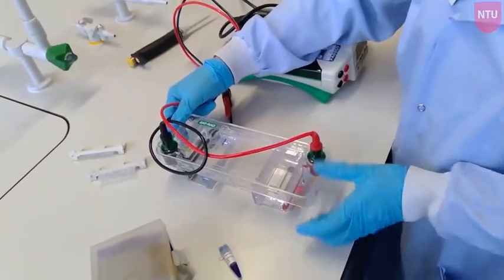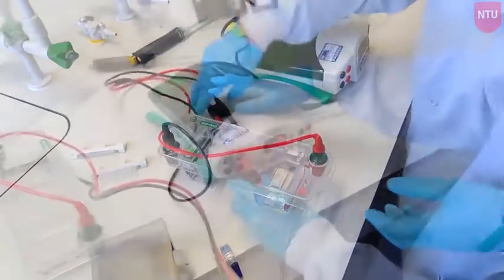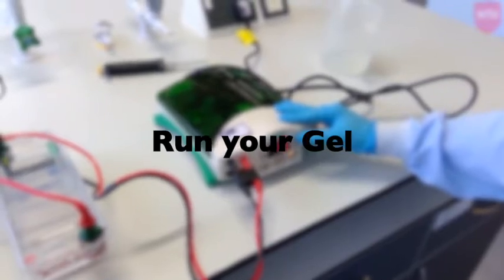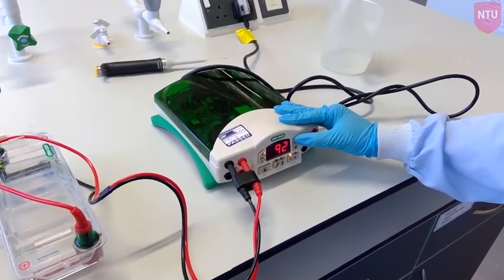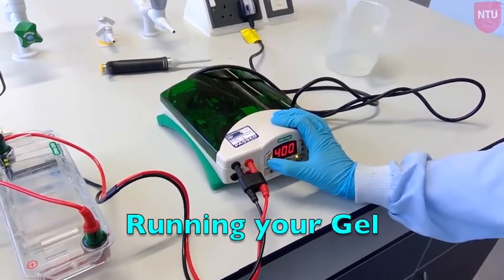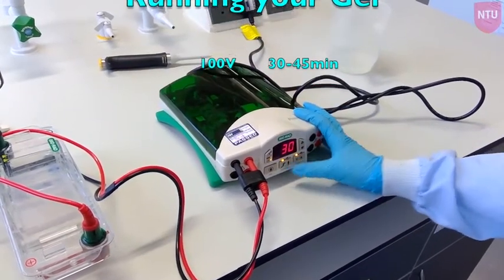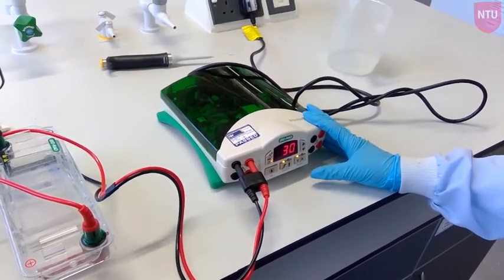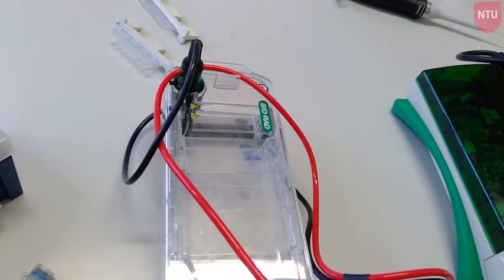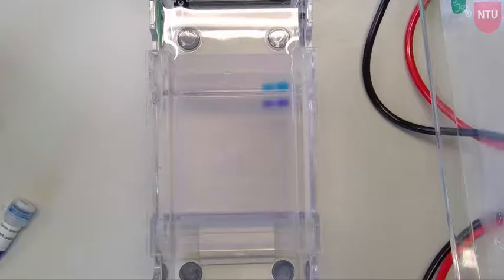Once you have loaded your samples, fit the lid firmly on the tank, connecting the red side of the lid to the red side of the base. Insert the cables into the power pack, connecting red to red and black to black. Set the voltage — often 100 volts — and press run. Bubbles should emerge from the wire on the black side; your DNA will migrate from the black side to the red side, so ensure samples are loaded near the black end.